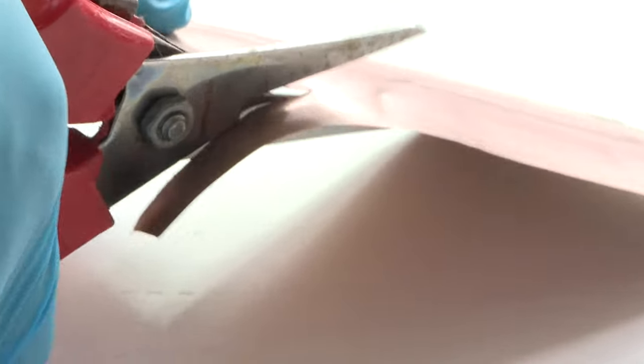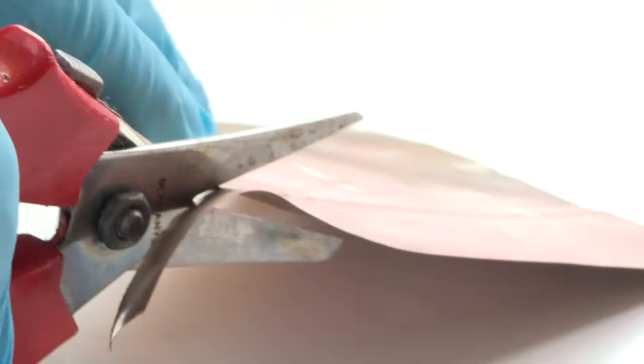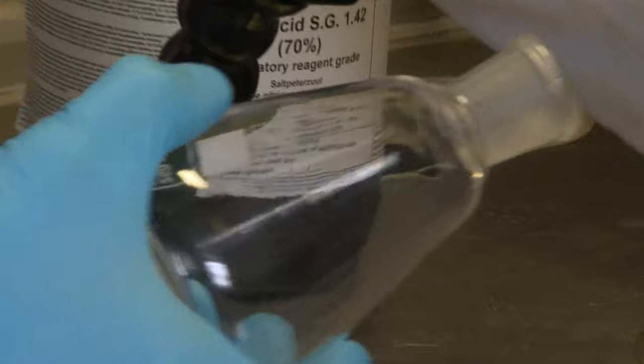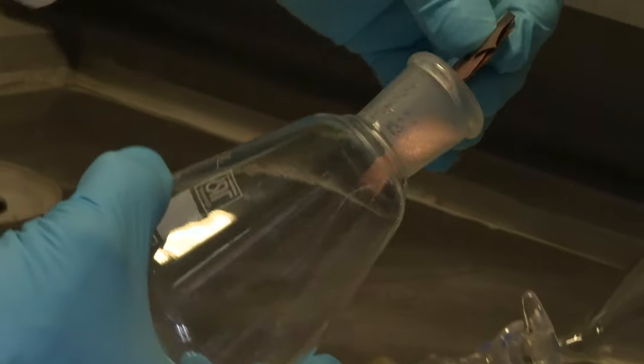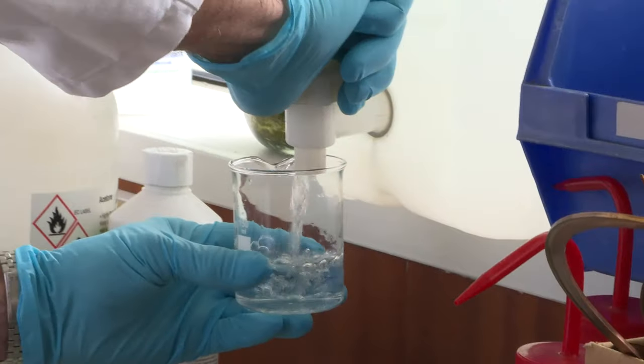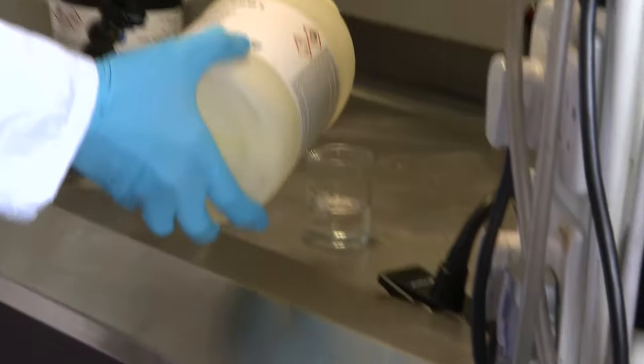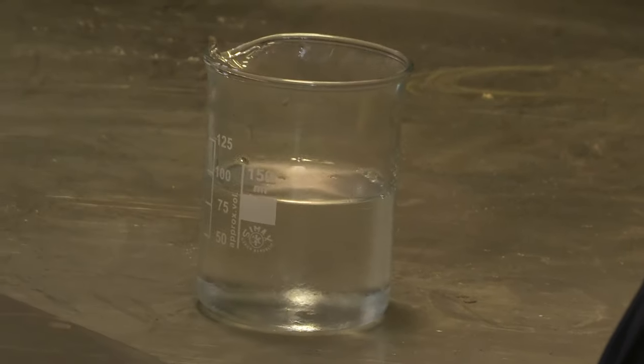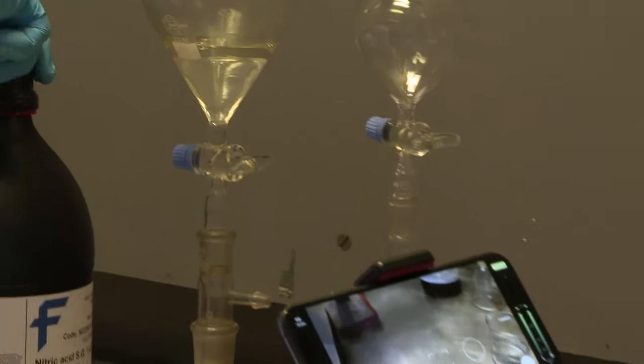Neil's all-time favorite experiment is the reaction between copper and nitric acid. Neil likes this reaction because you get a different result with concentrated acid and with dilute acid. So, for the demonstration, he ran the two reactions side by side, with concentrated next to dilute.